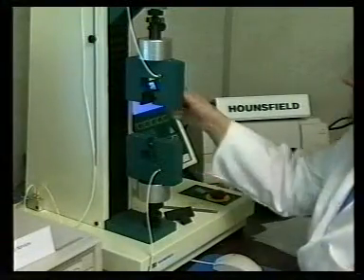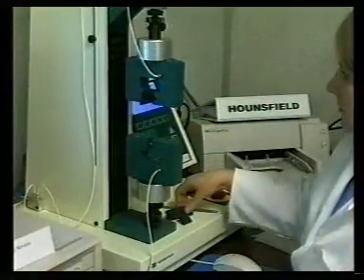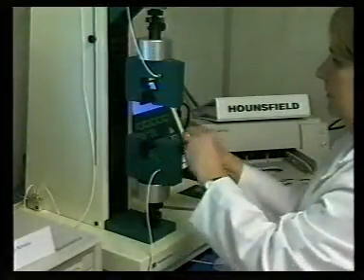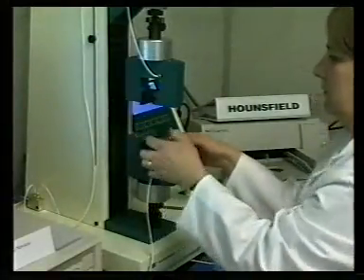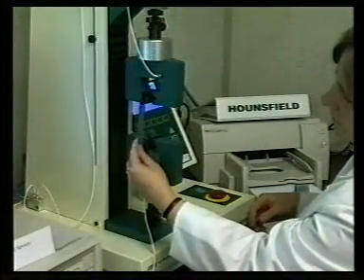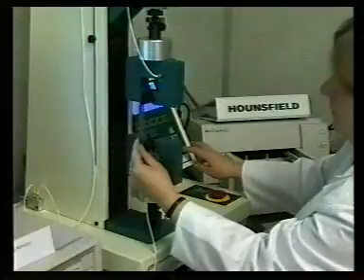The Hounsfield is set up with the correct jaw faces in both the top and bottom holders. The back jaw face being 75mm by 25mm and the front face being 25mm by 25mm. The gauge length — the distance between top and bottom jaws — is set to the specified distance.